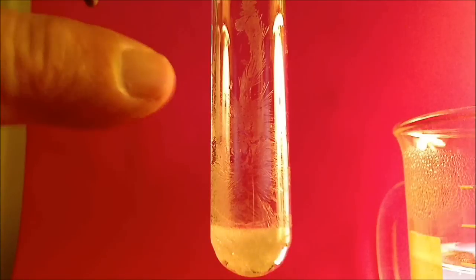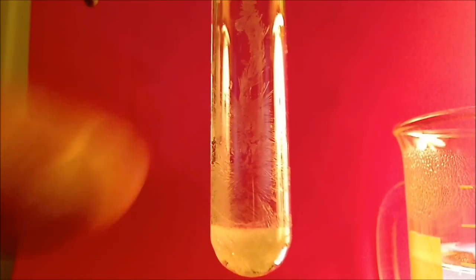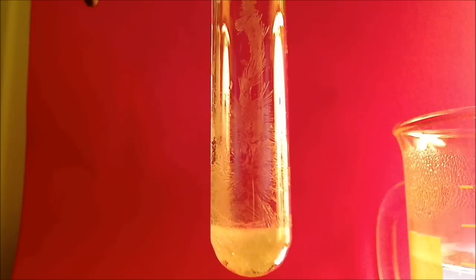You can see some nice crystals up at the top that have kind of vaporized and condensed higher on the test tube. And now I'm going to illustrate dissolving, which is an entirely different process from melting. The crystals are at room temperature, well below their melting point. I'm going to add the acetone, which I'll use to dissolve the crystals.